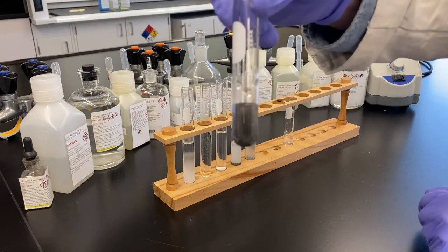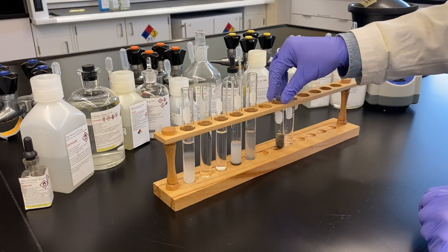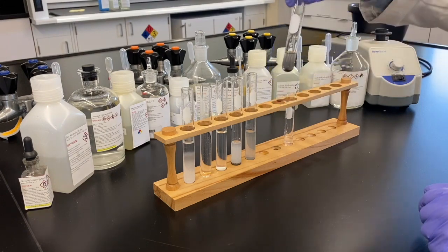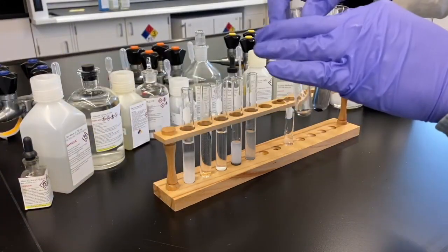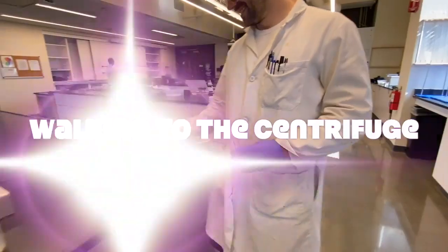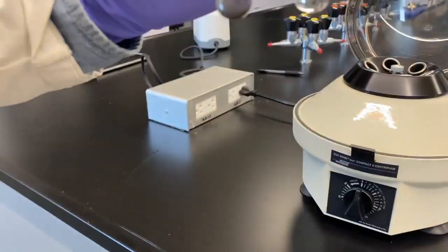No. Hey, we've got that black. So what was that from our observations? Which you guys are all recording meticulous observations, I'm sure. Absolutely. Color changes, any funny jokes we say. Yes, that's good observational data. So that's definitely a mercury, right? Yeah, that was the mercury 1 that we saw. Okay, cool. That looks oddly familiar. Yeah. That's a new clip.